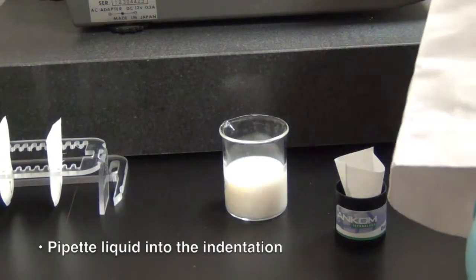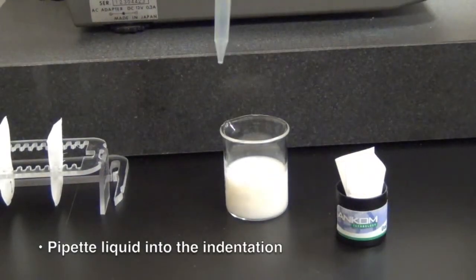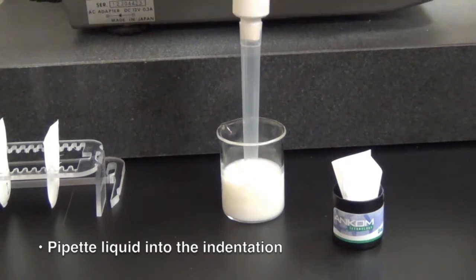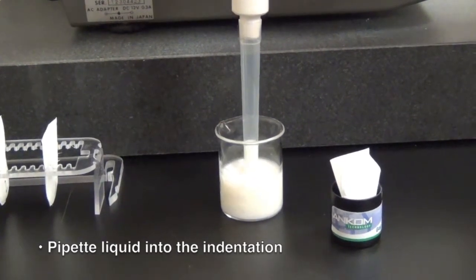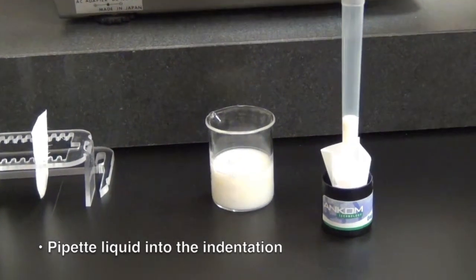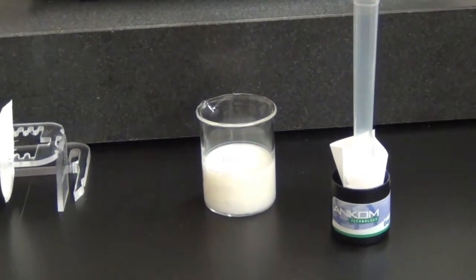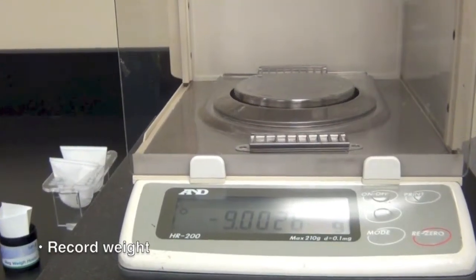Pipette enough liquid into the indentation that can be fully absorbed, but an amount that does not overflow the diatomaceous earth, and record the weight.